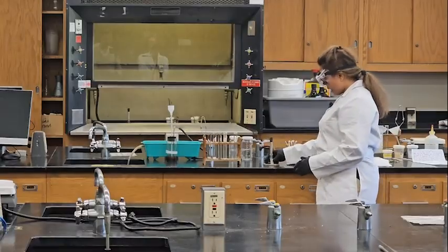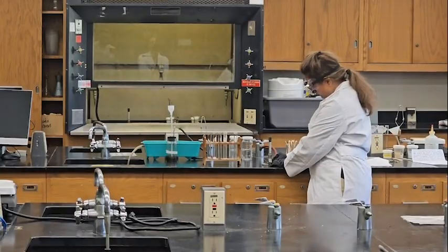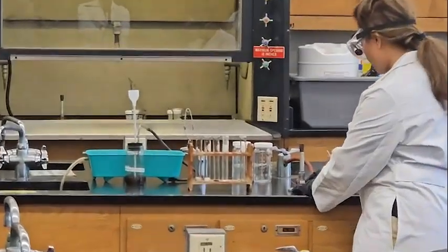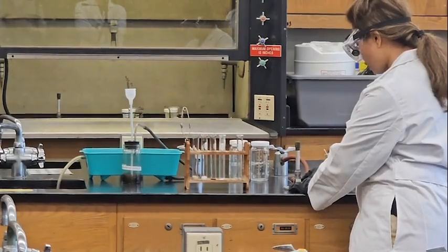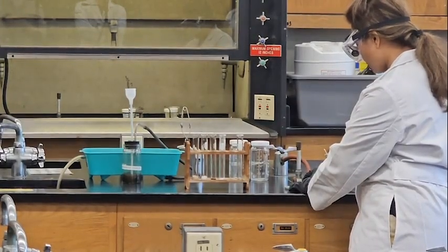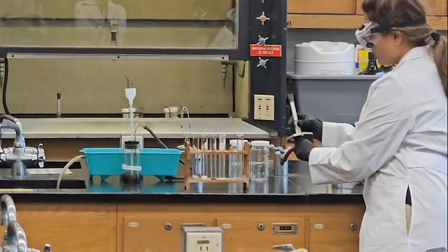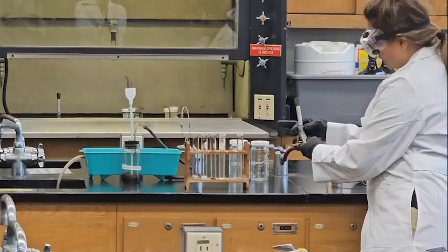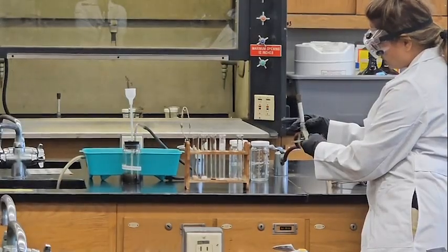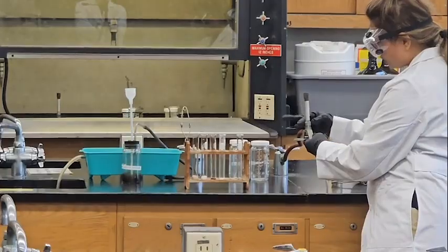Let's see how you use the Bunsen burner. It actually has two knobs. The bottom part controls the gas. Turning it counterclockwise closes the bottom part. Counterclockwise is this way, all the way down, so it is already closed. This other part helps you control the air. This one is counterclockwise, and this one should be clockwise.